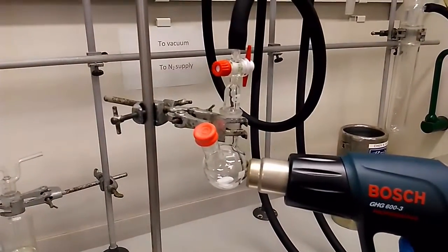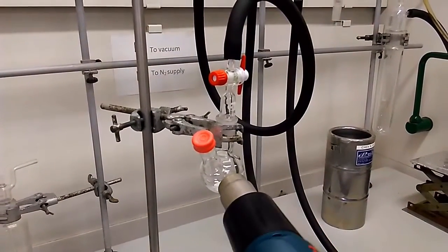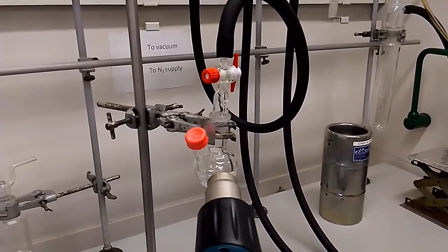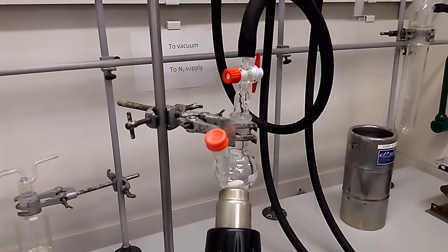And be careful, do not allow any of the tubing to get into your way to be entangled. And make sure that your hot air is not blowing at any part that is not made of glass or metal. So here we need to dry.